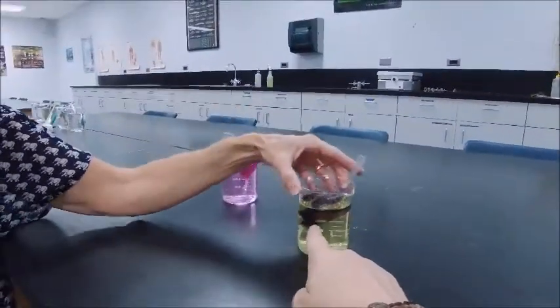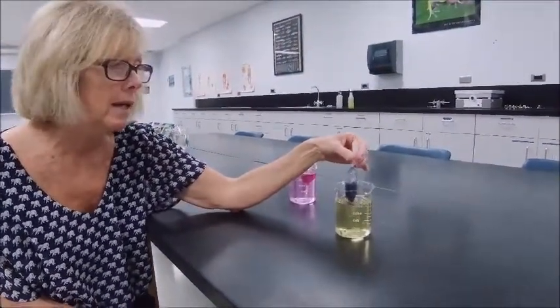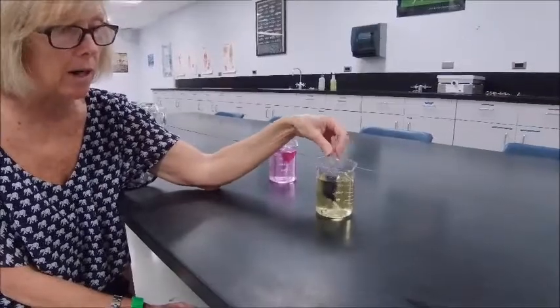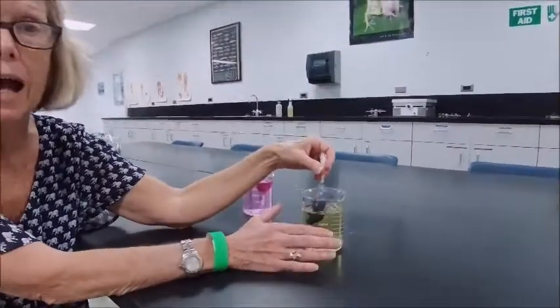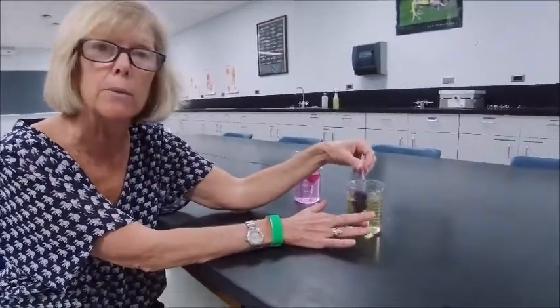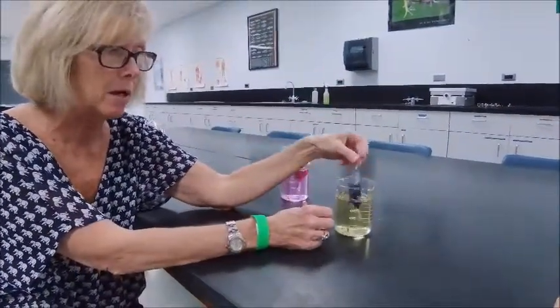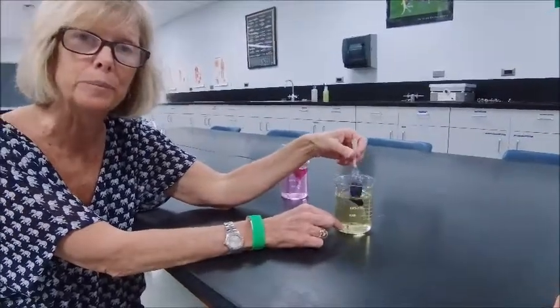For the starch and iodine bag: the starch was a cloudy milky color, and now the bag is dark blue-black — which happens when iodine contacts starch. The beaker water remains the same color as the iodine at the start. This means starch did not diffuse out, but iodine diffused in across the membrane. The reason: iodine is a very small molecule, but starch is a large polysaccharide complex — too big to diffuse through the tiny holes in the membrane.